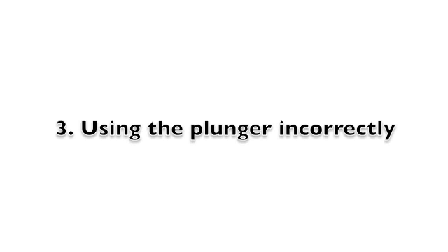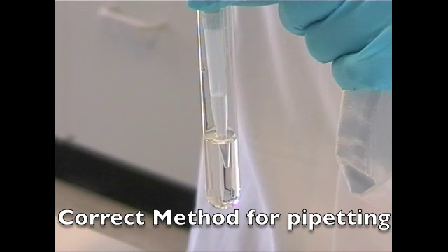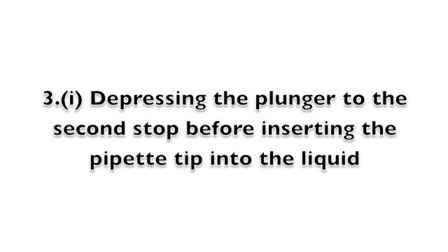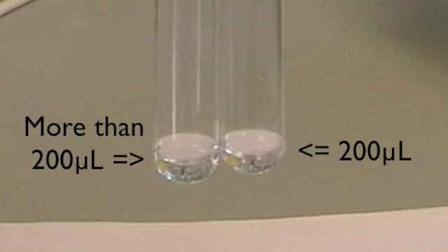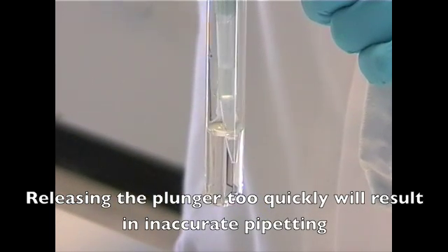Using the plunger incorrectly is another common error. The correct method for pipetting is to depress the plunger to the first stop or point of resistance, immerse the tip in the liquid, and slowly release the plunger to its starting point. Depressing the plunger to the second stop before inserting the pipette tip into the liquid is incorrect and will result in an excess amount of liquid, as shown here. Releasing the plunger too quickly will result in inaccurate pipetting and may cause liquid to be drawn into the barrel of the pipette, which may then have to be repaired.